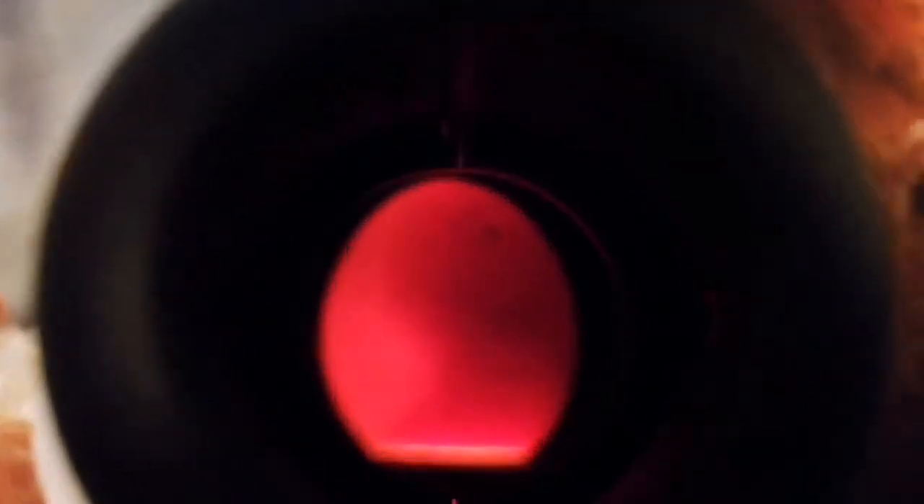There's something there — it's alive! Susan, will you do me a favor and turn the base? Oh, I see — it's alive! This chicken is alive, it's growing! Isn't it? Being in the first trimester, definitely got a little baby there. It's tiny. There we go, full circle now. Oh god, there is a life in this!